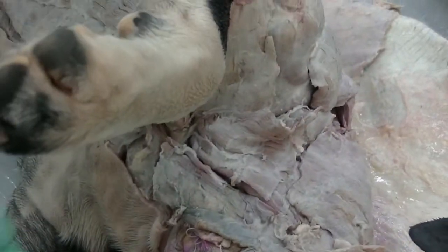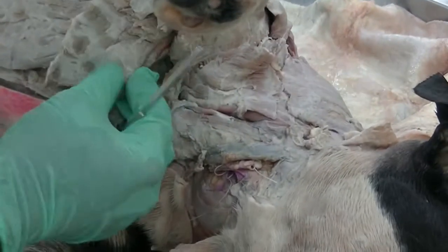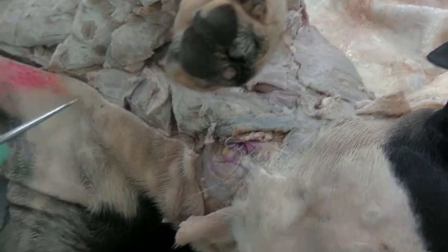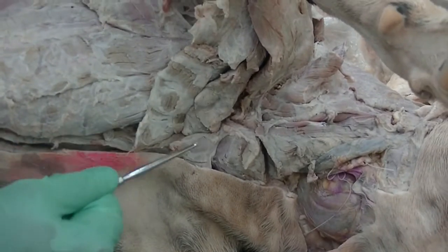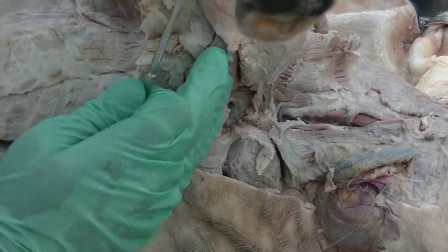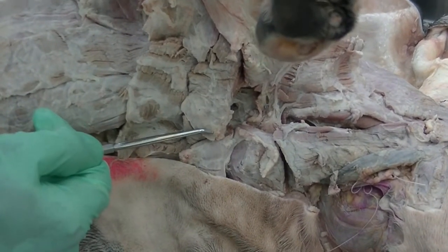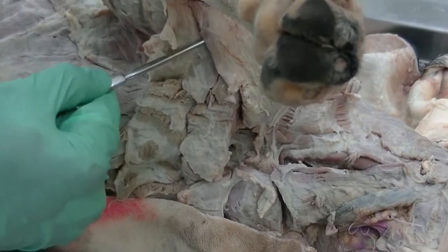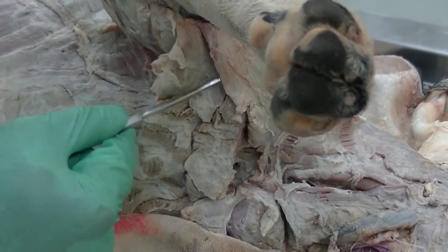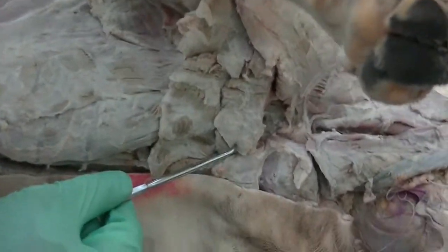Here some of those muscles have been transected. So as we put them back in their order, we can see from the ventral midline, the muscle which goes from the sternum. If the limb is held in the actual position the way it would be in the live animal, the muscle seems to be running backward to get attached to the humerus in the arm of the forelimb, that is your descending pectoral muscle.